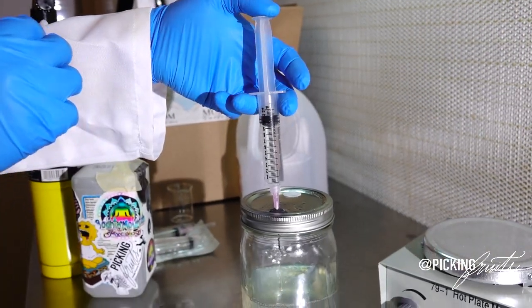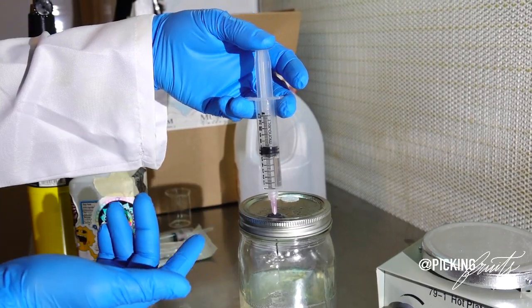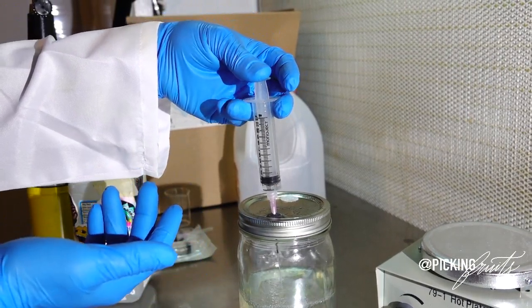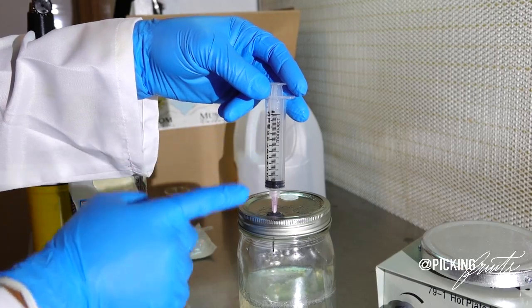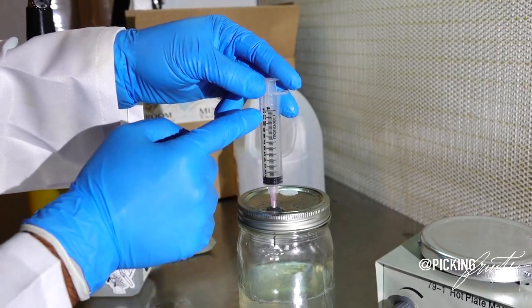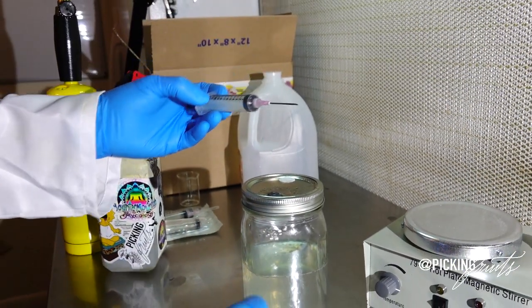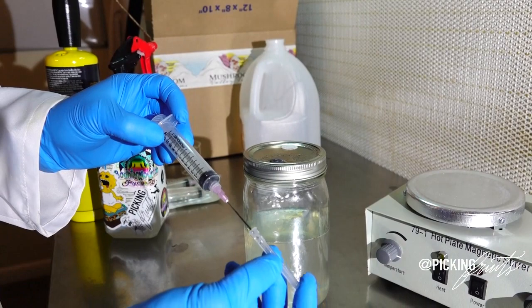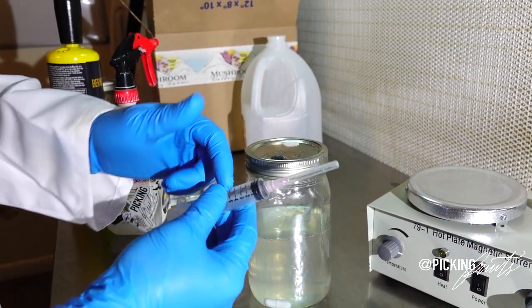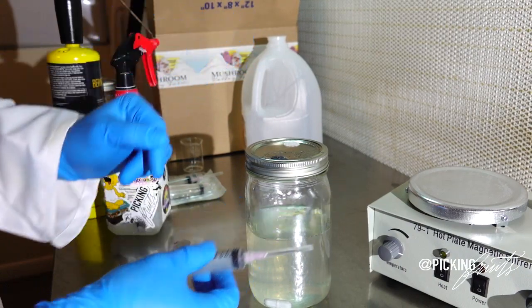Now, you can use as much liquid culture or as little liquid culture as you want. For this demonstration, I'm just going to use the whole thing. You definitely don't have to use so much. If you want to conserve your liquid culture for later use, you can definitely just use a single milliliter or two milliliters. And store the rest for other projects. Liquid cultures store well in the refrigerator and they can last you years if stored properly.